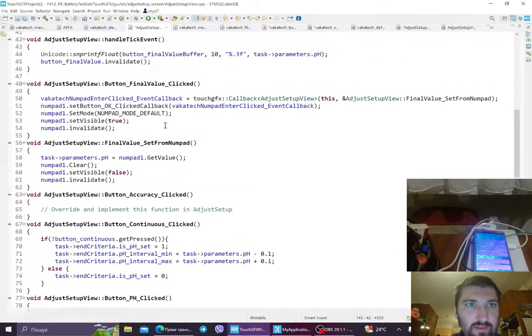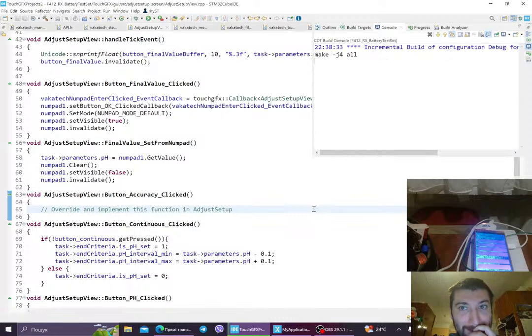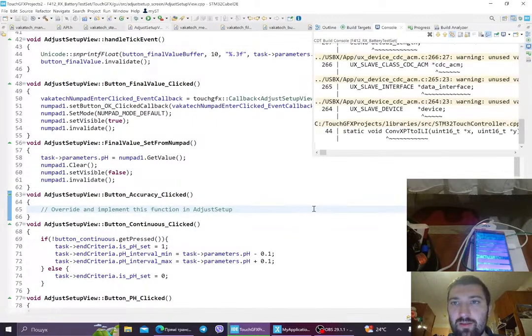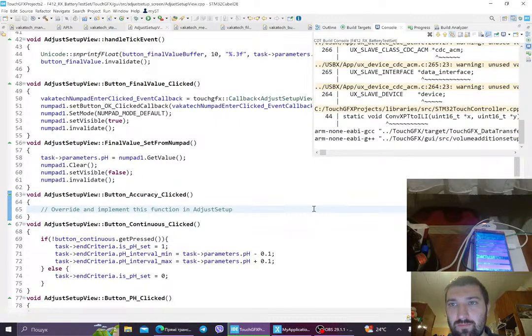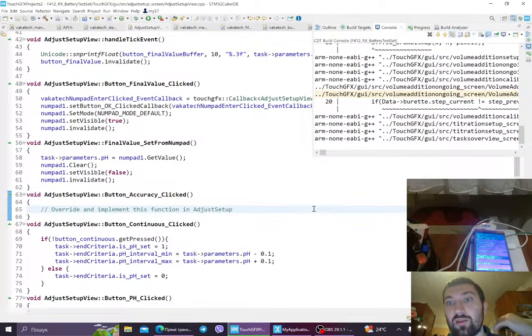And then we're starting this. Okay, let's see if it works as intended. And now I'm gonna send it to the board. Let's see if the board is clearly visible. The board is definitely clearly visible. Okay, so it takes some time because again, I don't have a very nice laptop still. It won't be that long either. Actually, there's a lot of time that I spent just downloading the firmware, and as you see right here, I'm not even uploading the part that goes into the external flash.